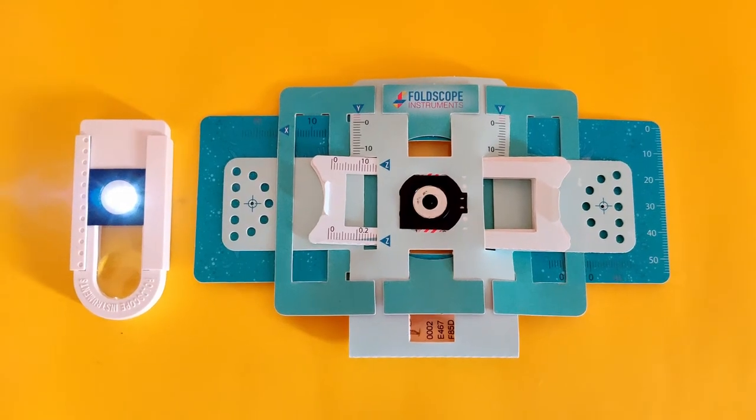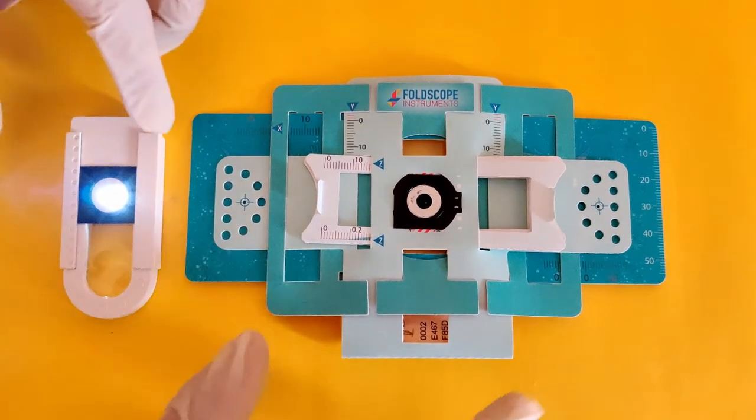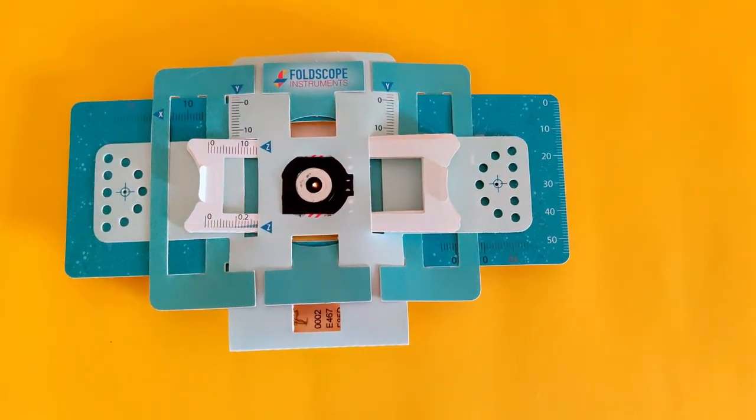Look into the lens while holding the foldscope to a bright light. For the purpose of this recording, we are using a light source attachment.